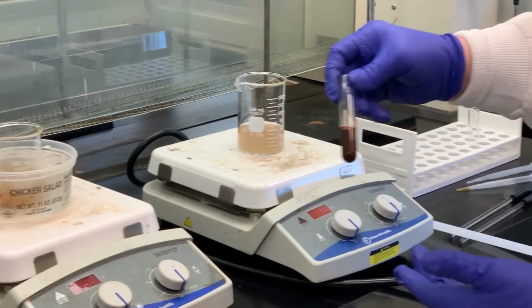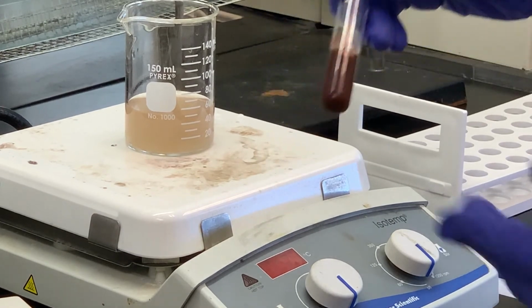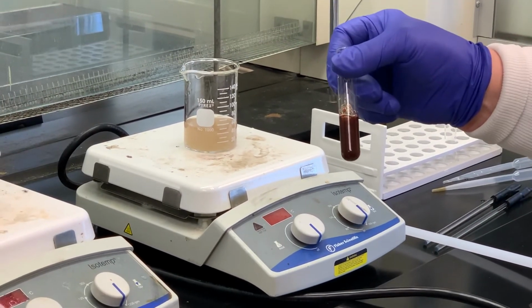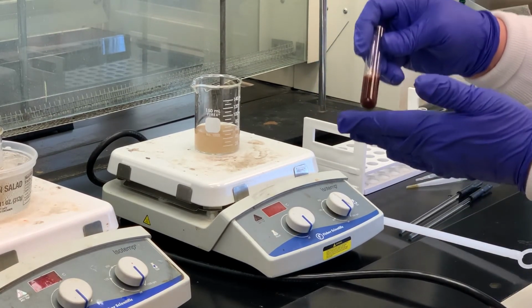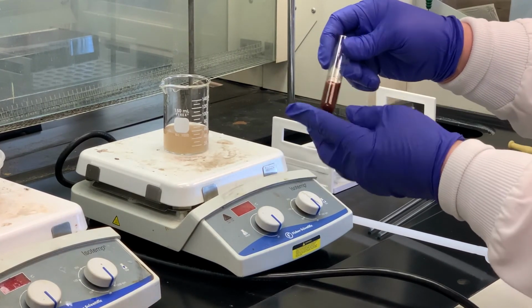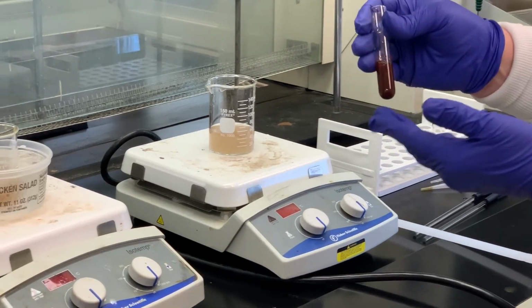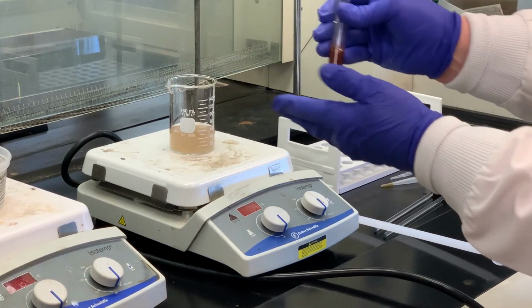And take a look at that dark red dye stuff. So this is a solid, you can't see through it, and I'm not sure if you can see the actual solid, it may be hard to see. But this is the dye stuff, this is the para red that we just made. So think about this, if you wanted to make this and isolate the dye, you would simply combine those two together, let them stir for a while, and then collect it by vacuum filtration. So this is how you can make the dye stuff.